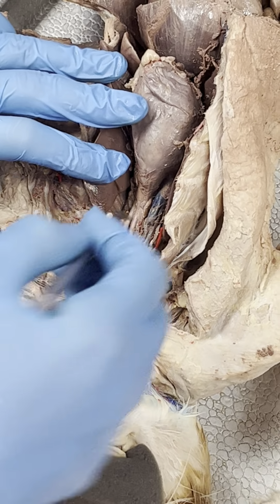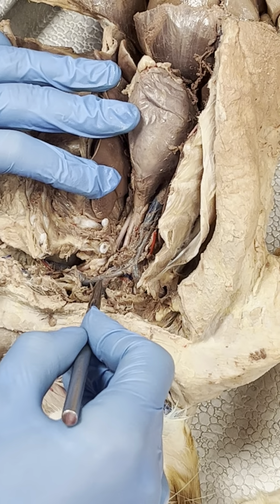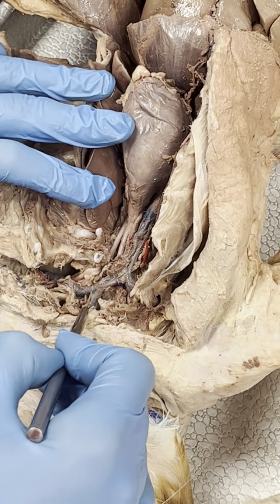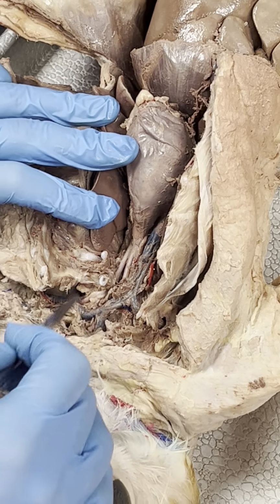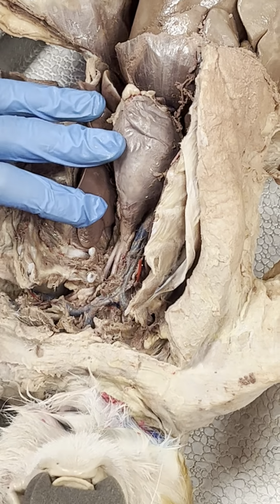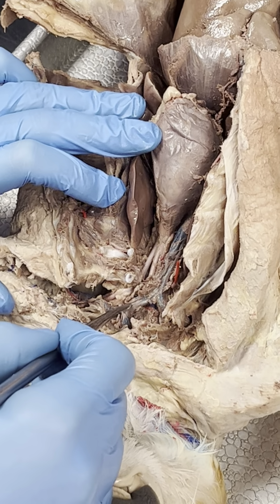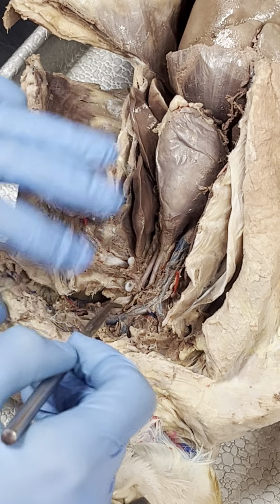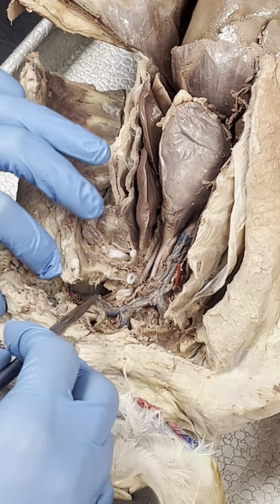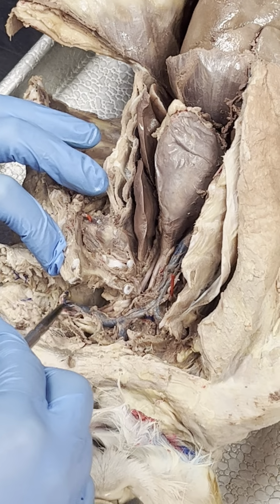So we've got this first split here, and I'll go ahead and follow it on this side. Then the brachiocephalic vein is going to split into jugular. On the cats, you can just say jugular. We've got internal and external on the Anatomage, so just make sure you check that out. And that's going up into the head. Then this branch here is going to be our subclavian vein. It's a really short subclavian vein before you reach the axillary vein. And if you keep following that into the arm, that's going to be the brachial vein.